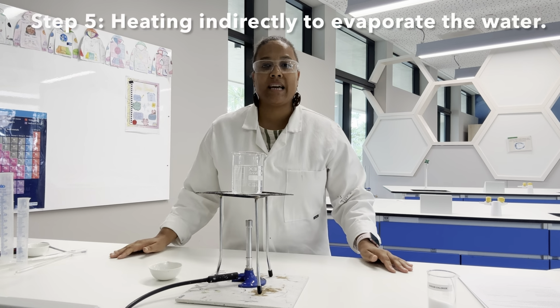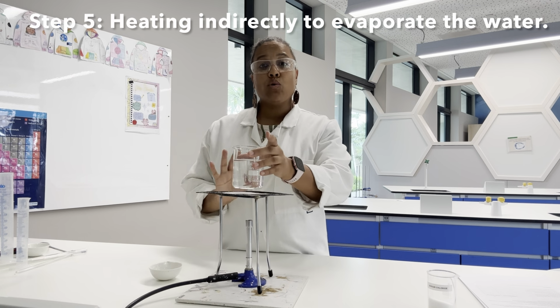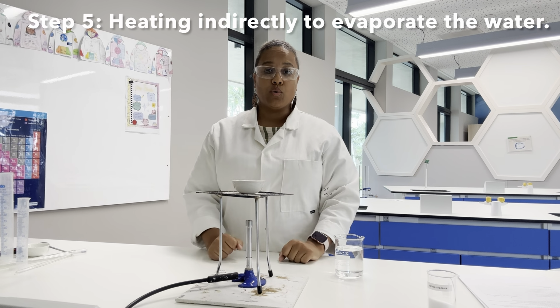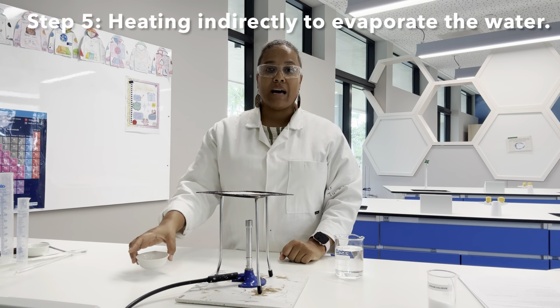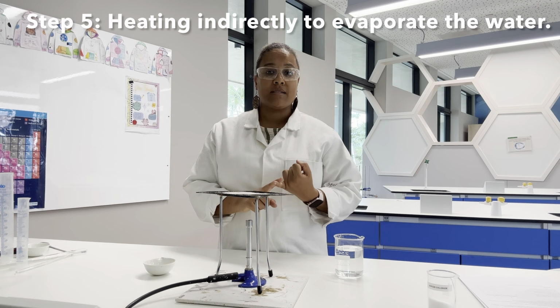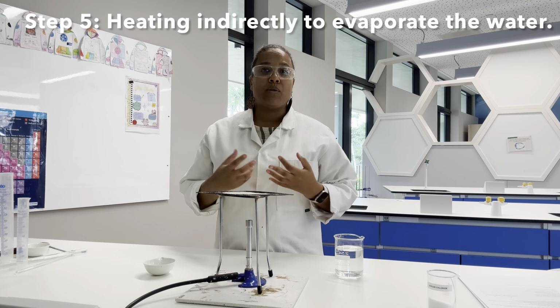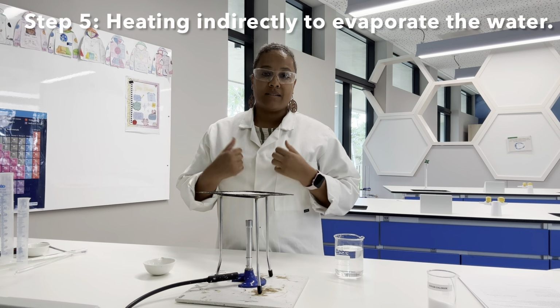Now, what we're going to use today is called indirect heating. Normally we would put our evaporating basin with our solution straight onto the gauze, but today we're not going to do that because we don't want our crystals to spit. We also don't want thermal decomposition, and we don't want that liquid evaporating too quickly and damaging those crystals.